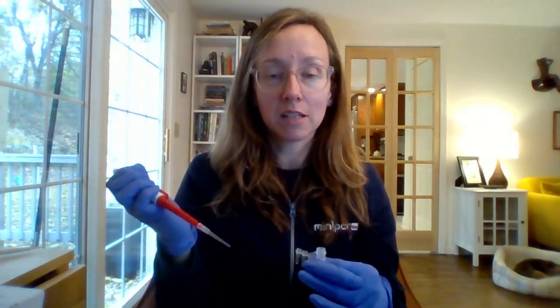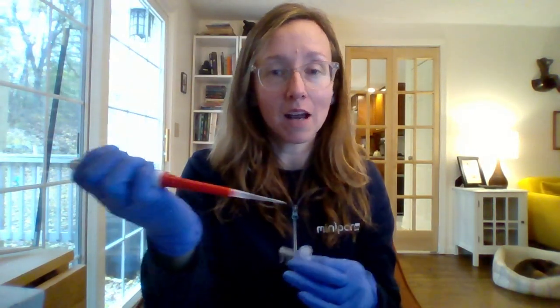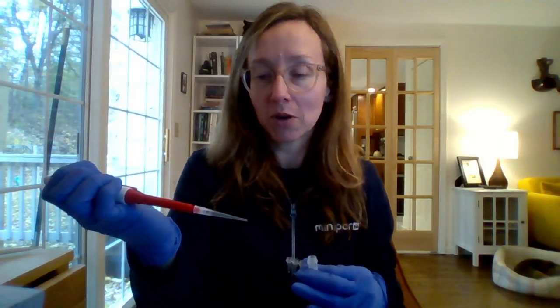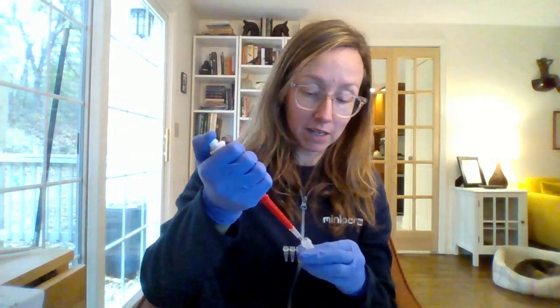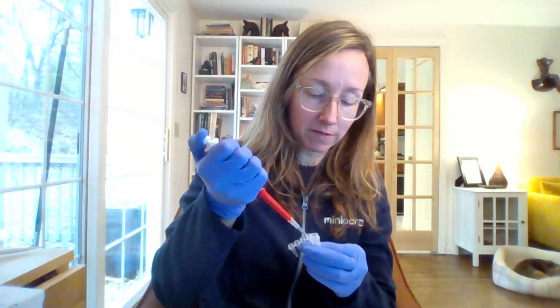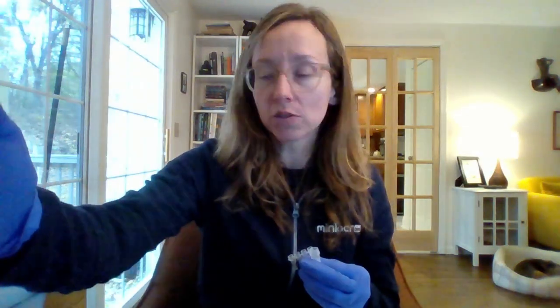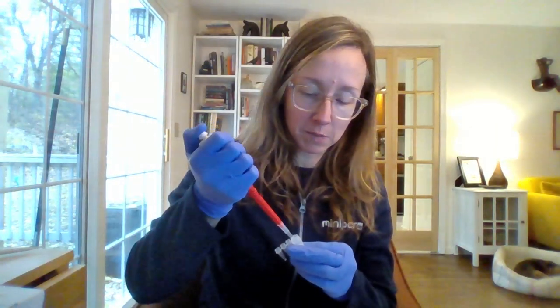We have a plunger here on top that we use to aspirate liquid. There is a little ejector button here on the side that we can use to eject the tip when we're done with it. And then I'm just using standard micropipette tips here, not special mini pet tips or anything. Just regular ones work fine. So mechanically, what students learn on this mini pet is going to translate when they pick up a variable micropipette. But because they don't have to dial in the volume, it removes one potential source of error. So it's a bit like pipette training wheels, this mini pet is.